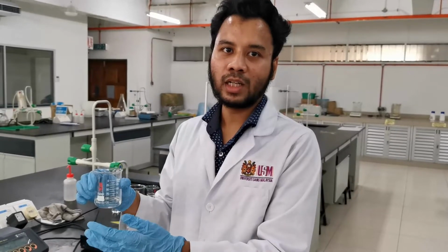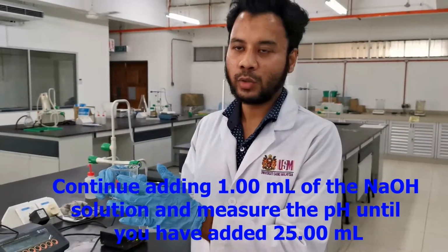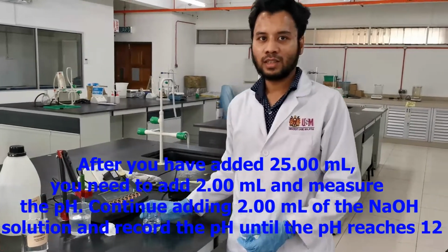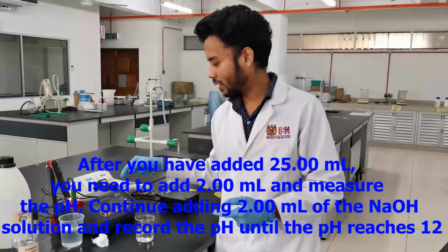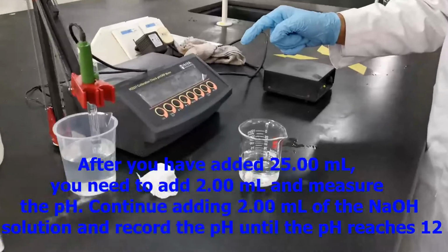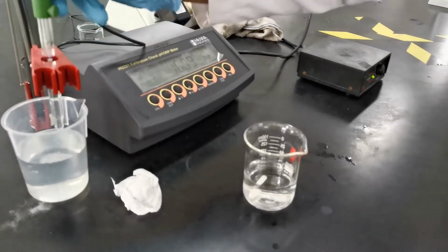Likewise, you continue adding 1 ml until you have added 25 ml of the sodium hydroxide solution. At each 1 ml interval, you need to measure the pH, get the stable reading, and record it until you have added 25 ml. After 25 ml, you need to add 2 ml each time. At each 2 ml addition, you measure the pH until the pH reaches 12. So after it reaches 25 ml, you get the pH reading at each 2 ml addition of NaOH until the pH recorded is 12.